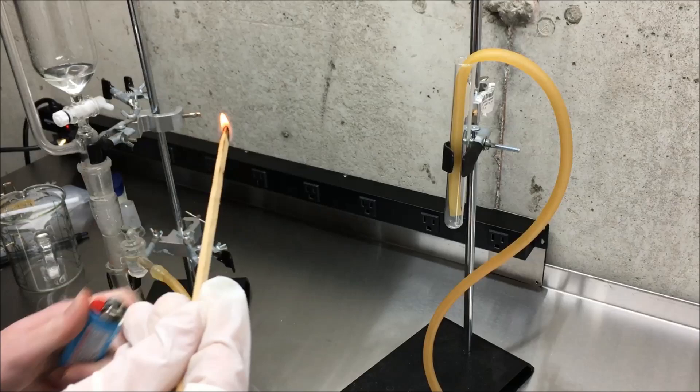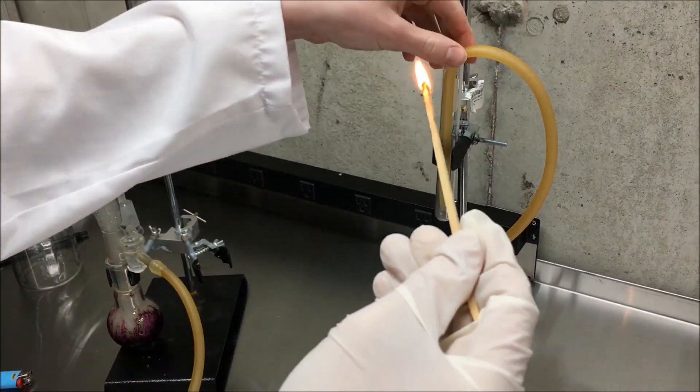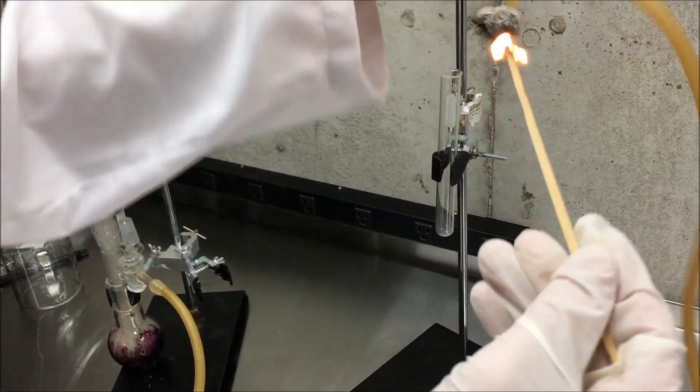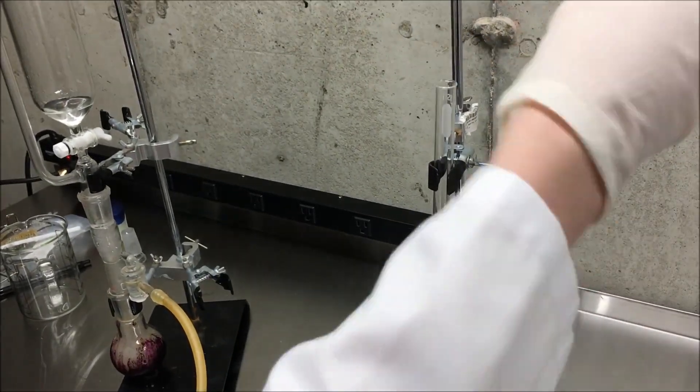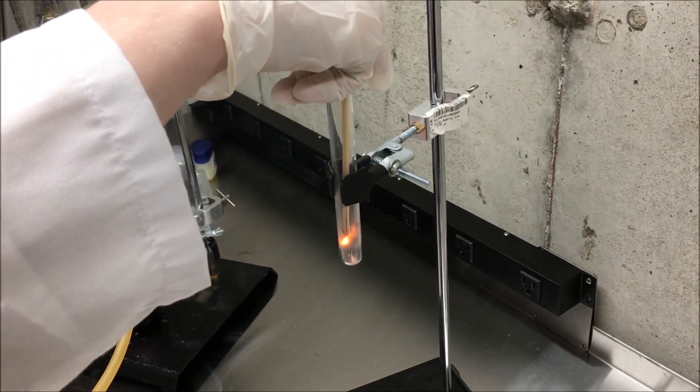Here is the first test of the oxygen gas. It does kind of reignite the flame. The second test will be better. Here we go.